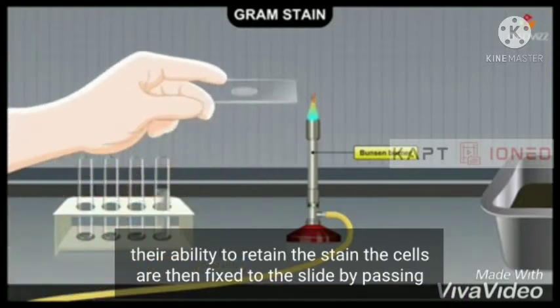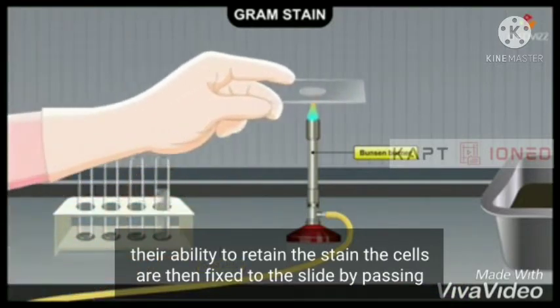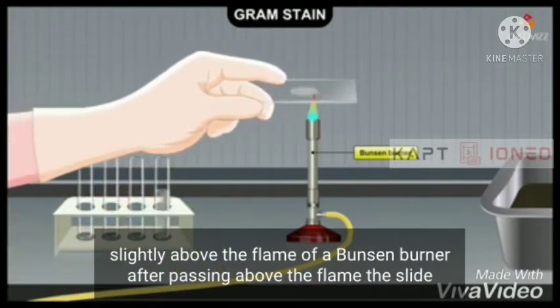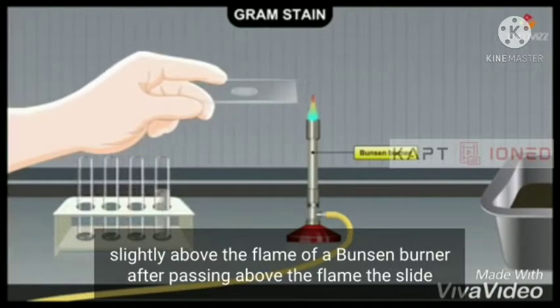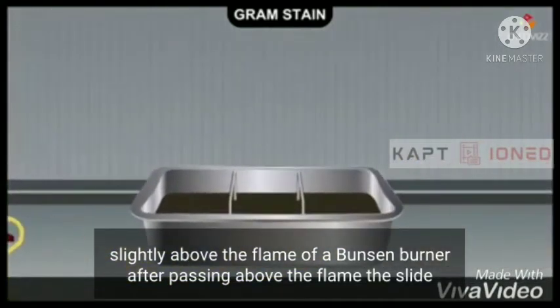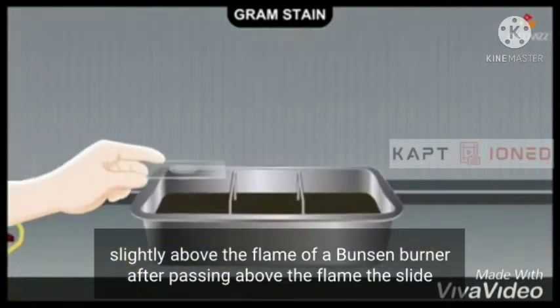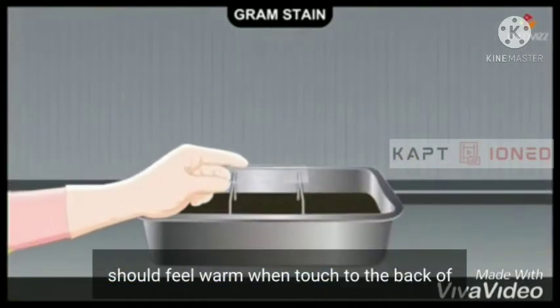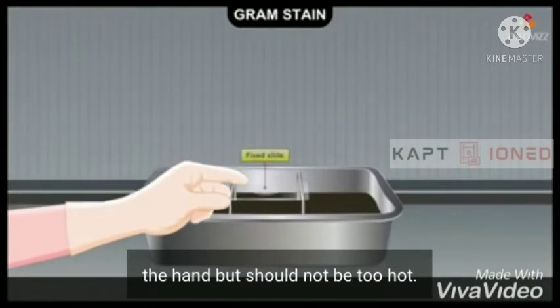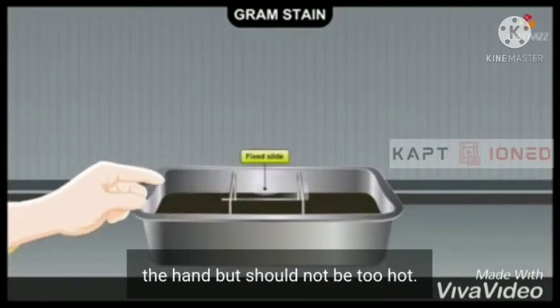The cells are then fixed to the slide by passing it slightly above the flame of a Bunsen burner. After passing above the flame, the slide should feel warm when touched to the back of the hand, but should not be too hot.